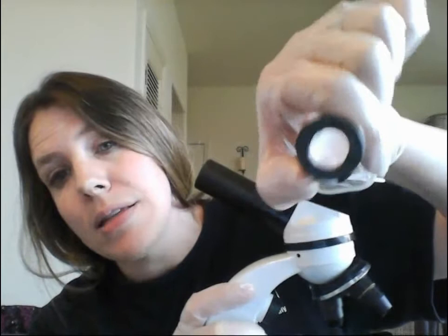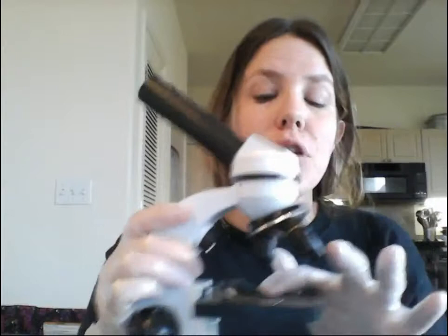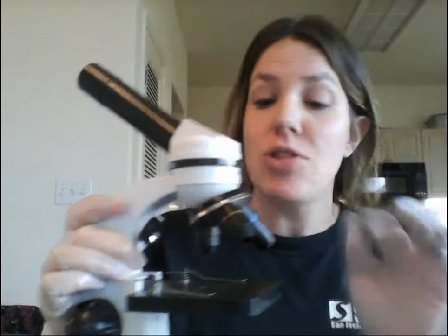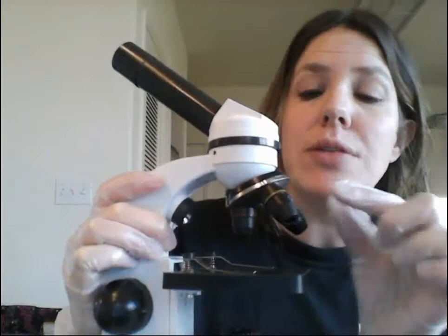Your eyepiece contains an ocular lens with a magnification of 10x by itself. That means your specimen placed on the stage will look 10 times bigger than it really is just from this. Each of the objective lenses has its own magnification — these are called objectives and they contain a lens called an objective lens.